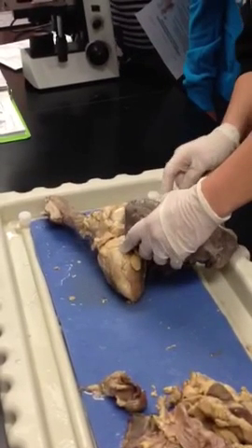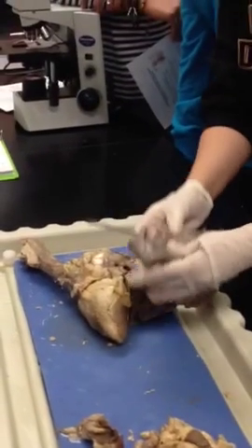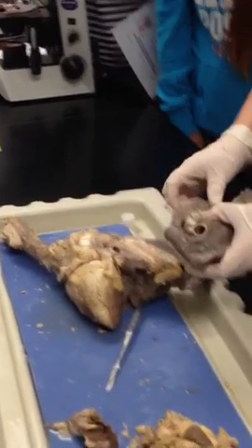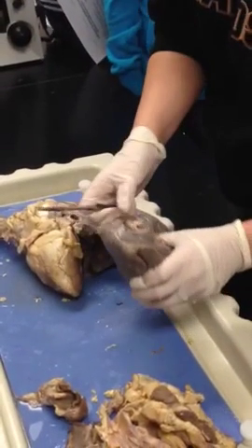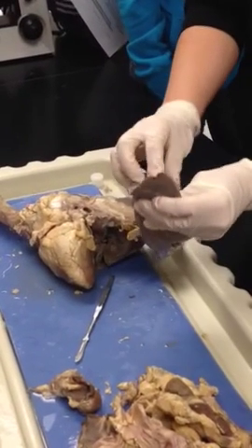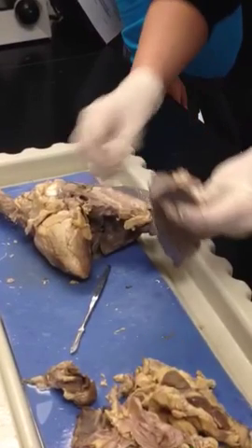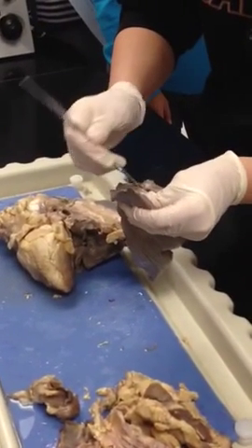This is sometimes why we use lungs that are already cut, because you can actually pull it out and look at stuff. But this is your primary bronchi right here. It's really large. You can't miss it. Okay? Primary bronchi. Smaller lobe's always on top, right? Yes? Yes. Yeah. This is really close.